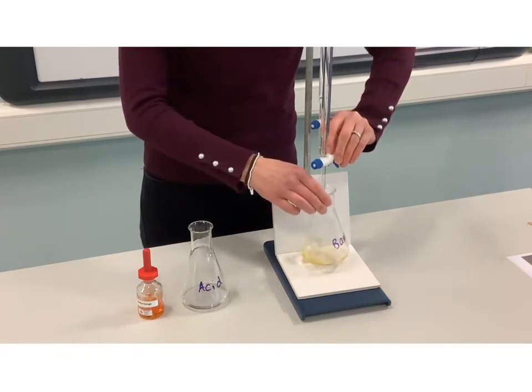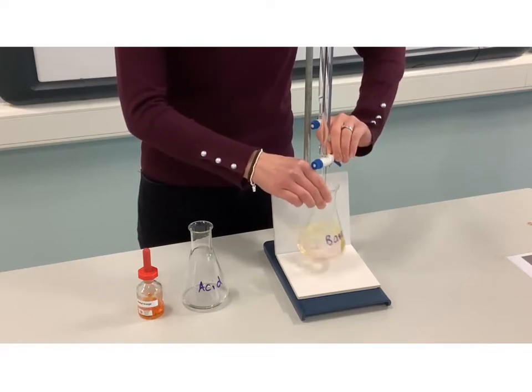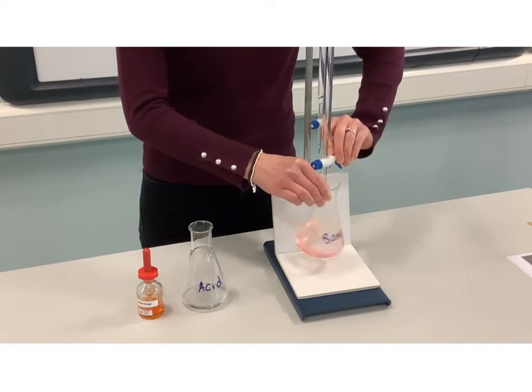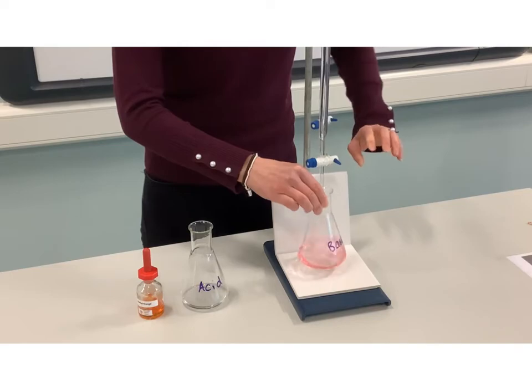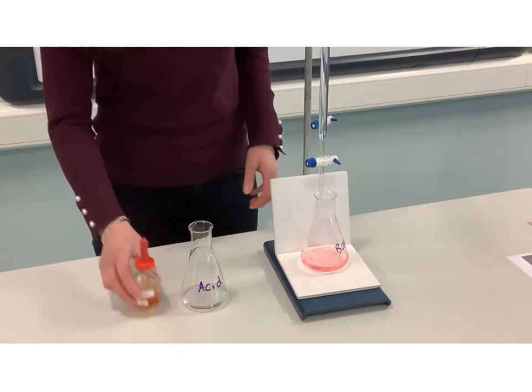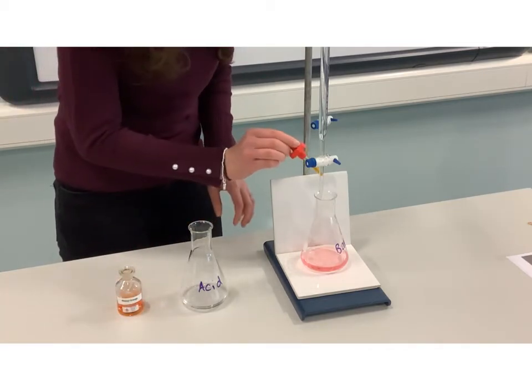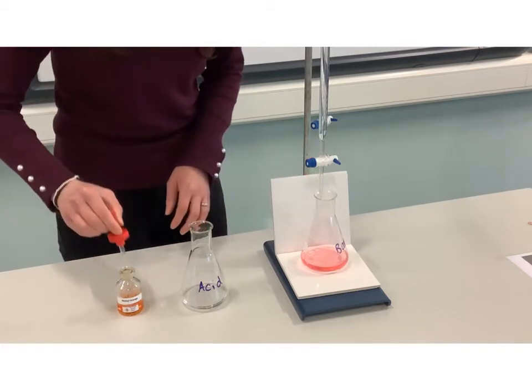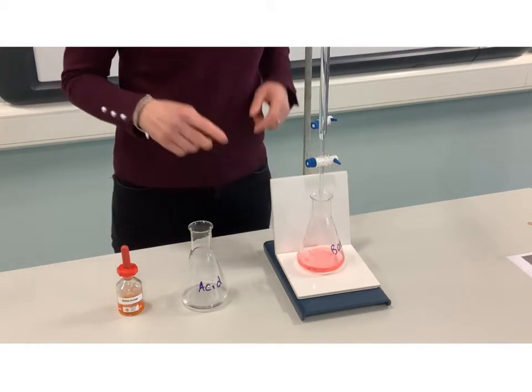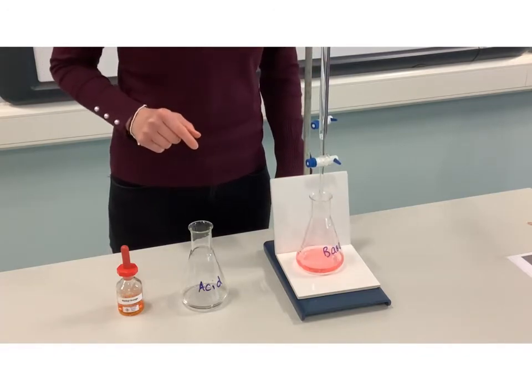I'm going to add my acid — again not too concerned about the volumes being precise. You can see it's starting to change color, but on swirling it goes back to yellow. Now the color change has finished and what we end up with is a pinky color that is referred to as red — it's probably because we don't have too strong a concentration of our indicator. The color change we refer to with methyl orange is yellow to red when going from a base in the conical flask and adding an acid from the burette.